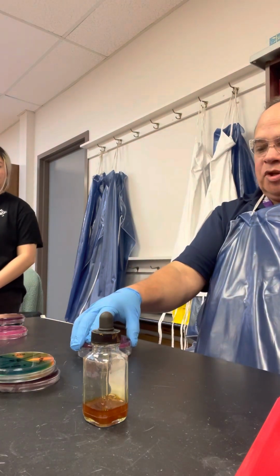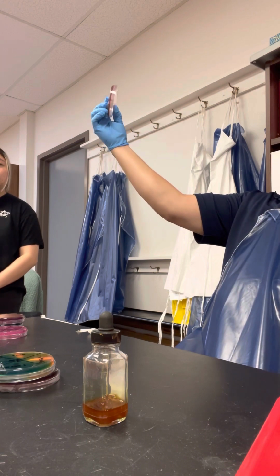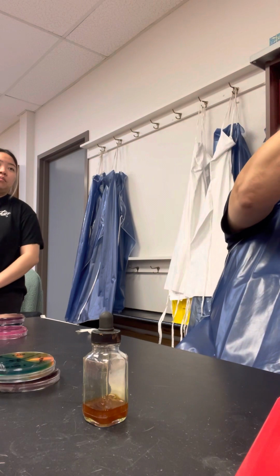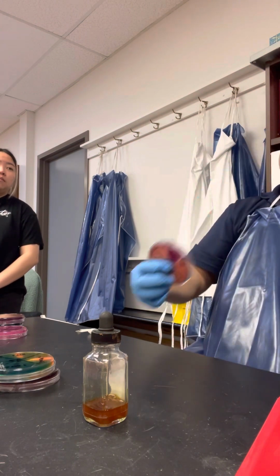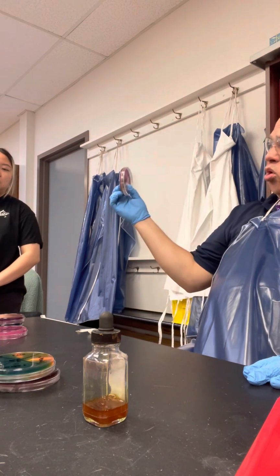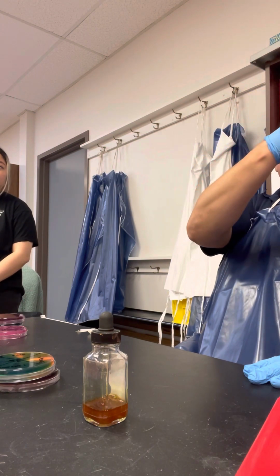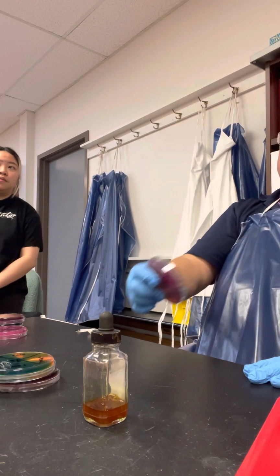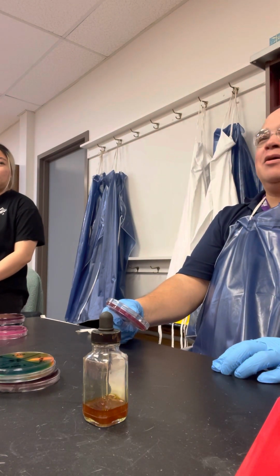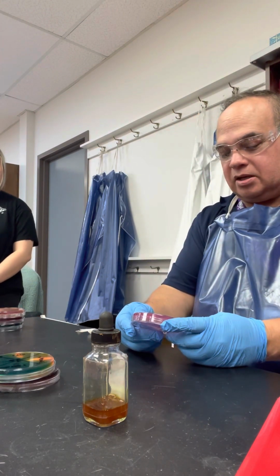So now there's something really interesting happening that you might see here. Can you appreciate that around the colony, there's all this cloudiness in the media? That cloudiness in the media is called bile precipitate. Only two organisms produce bile precipitate like this. Can you tell me which ones do that? E. coli. And? Citric. And Citrobacter. Not citric. Citrobacter.